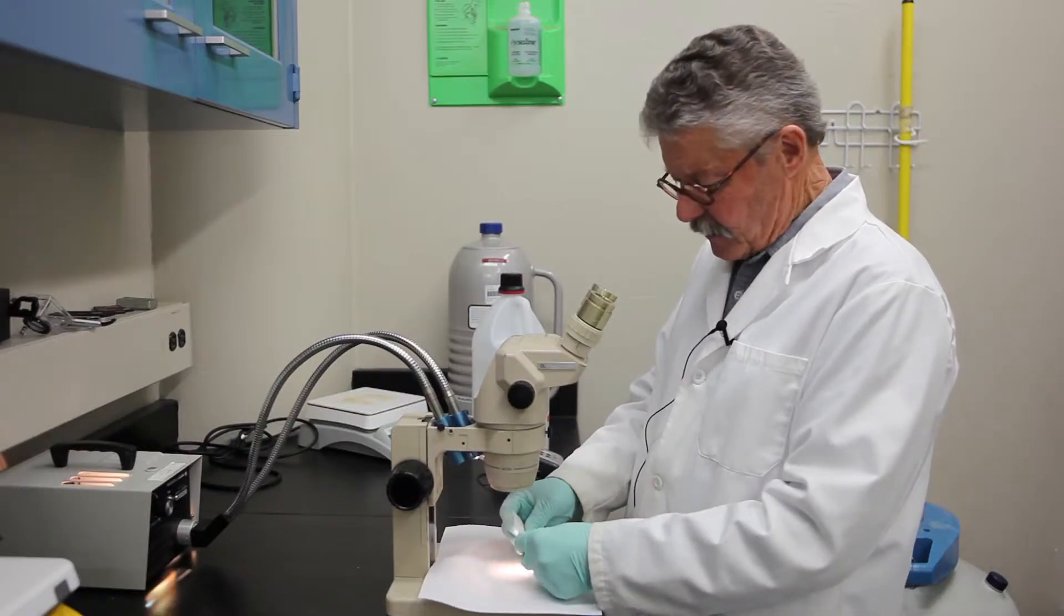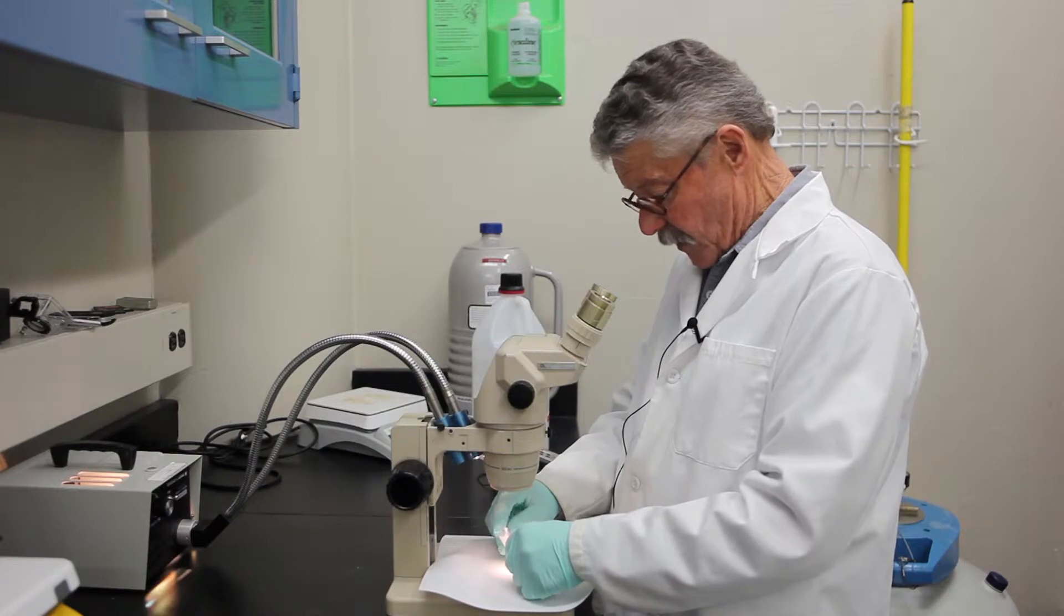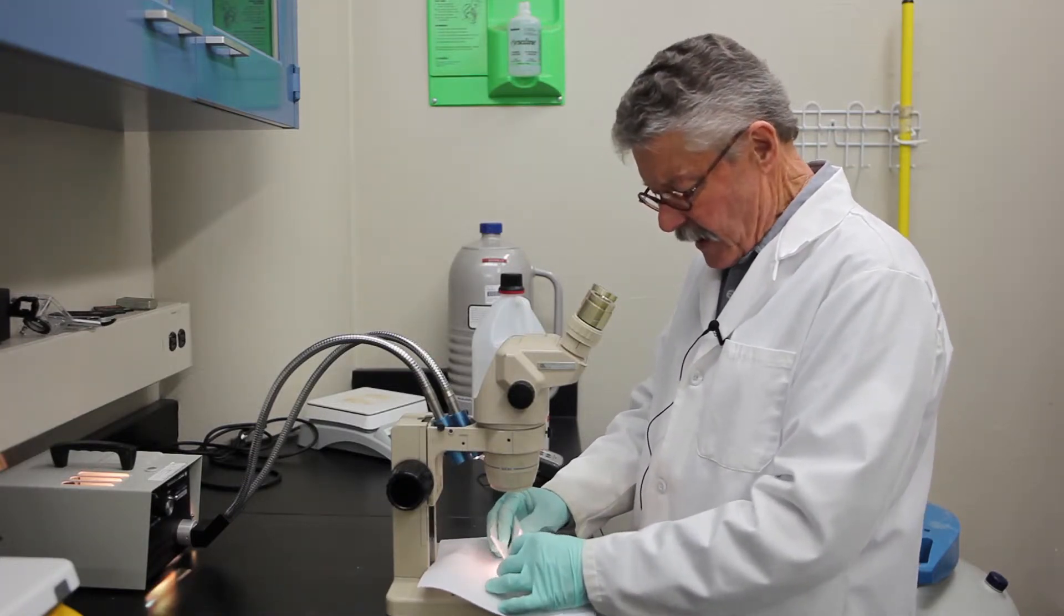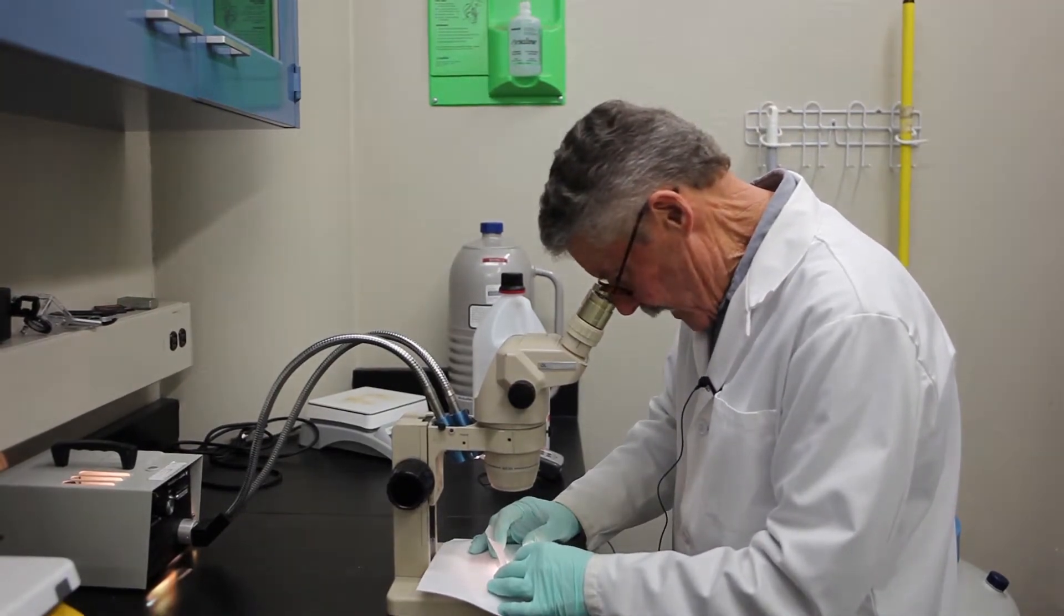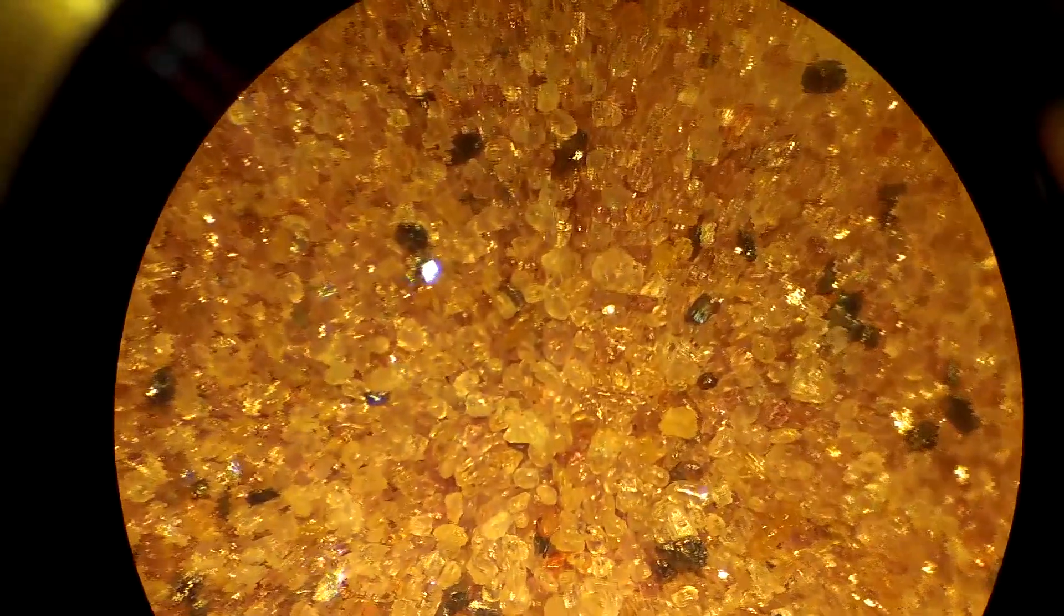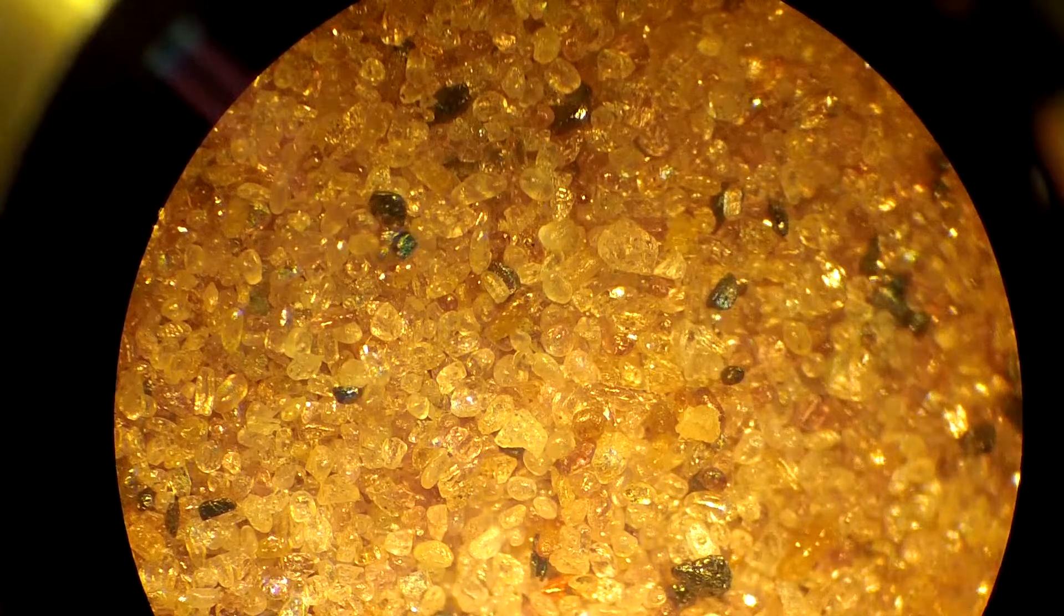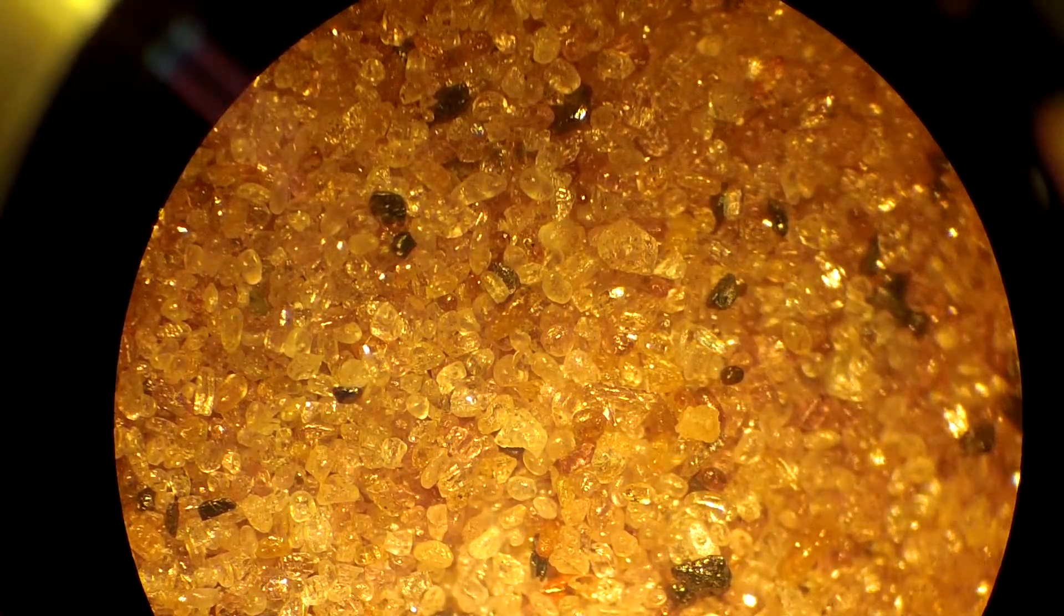I've transferred the sample now that it's dried and we've run it through the Wigglebug exactly two more times, so a total of three. And as you can see, we are down to the point where we now have nothing but zircon in here, pure zircon, no other minerals that can be detected.